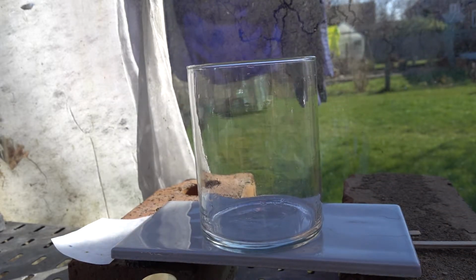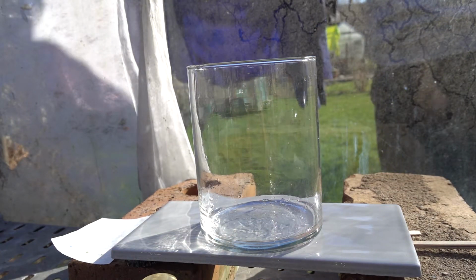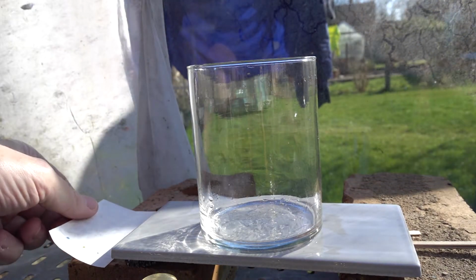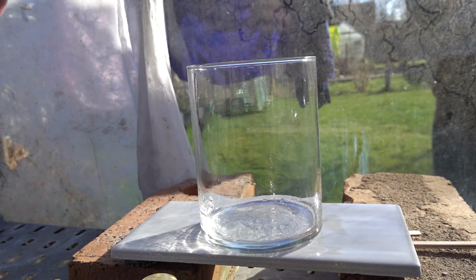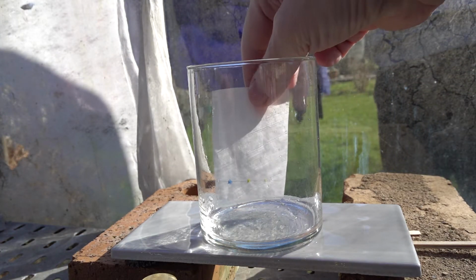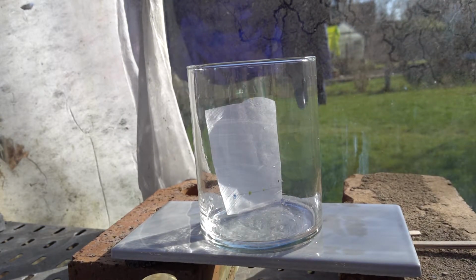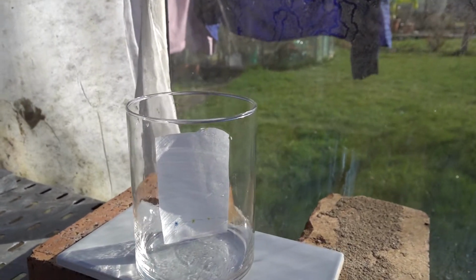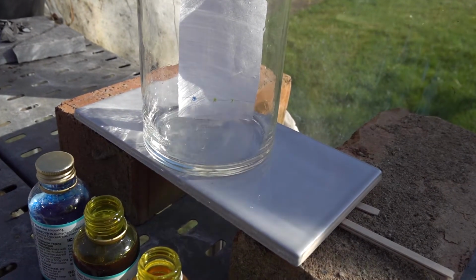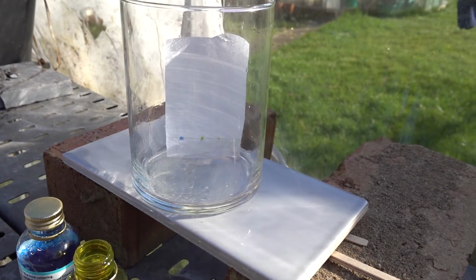There we go. And into that then we can now put our sample chromatogram ready to go. Here it is. And we can watch what happens. Try to keep it away from the wall of the container. Watch what happens at the beginning. So in it goes in one smooth movement, and we're looking to see what happens there as the solvent moves up to the line of the 3 samples.